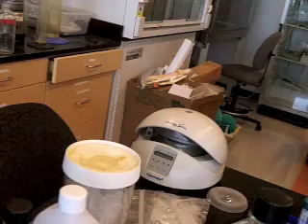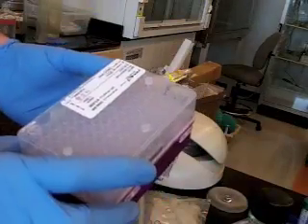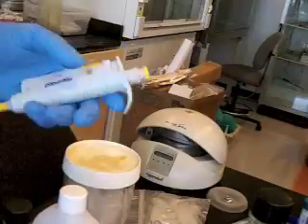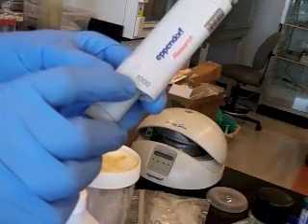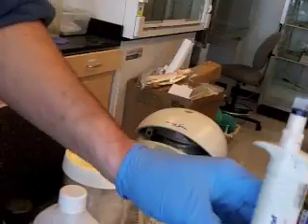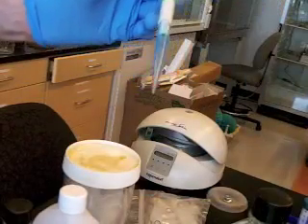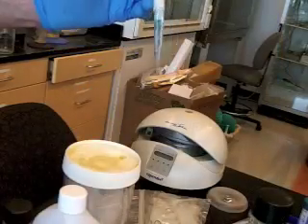Okay, next thing is that there are different tips. We always use a disposable tip, and there are 2 classic tips for micropipetting. These tips are often called yellow tips because historically they were yellow, and these tips are blue. The blue tips are used for 1 milliliter or 1,000 microliters. Those are equal volumes. So we've got blue tips for the larger volumes. Boom, like that. You just tap them on, and they're disposable. So I tapped it on, I took the lid off, I put the lid right back on.